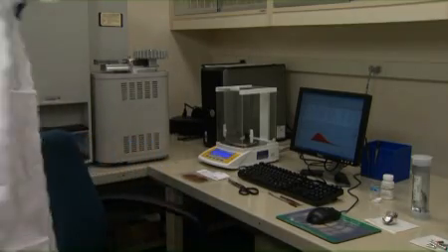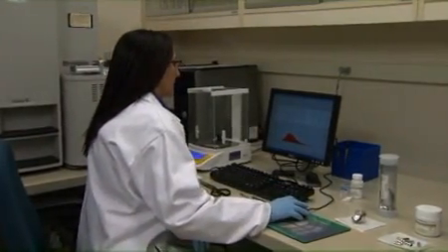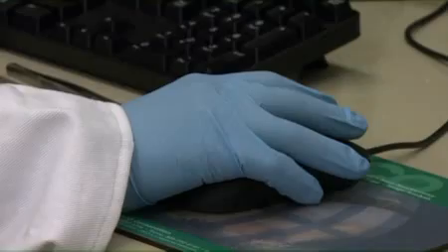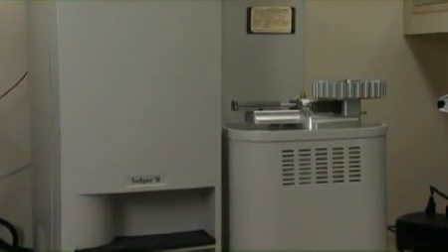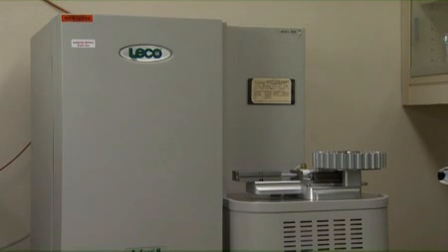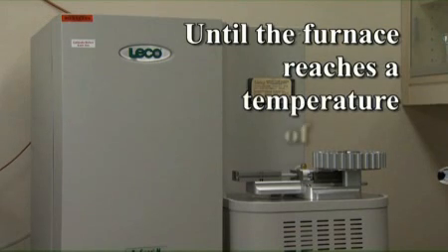The LECO TruSpec software is configured in such a way that all of the instrument checks can be performed through the computer. All analysis runs can be logged and controlled, and calculations are automated. When not in use, the instrument is left on. The gas flows automatically revert to standby mode when the instrument is not in use. If for any reason the instrument has been without power, it must be turned on and equilibrated until the furnace reaches a temperature of 950 degrees Celsius before use.